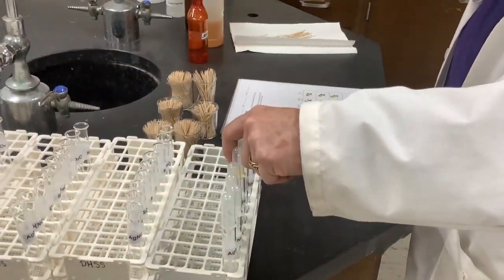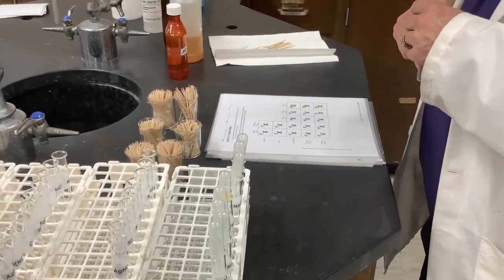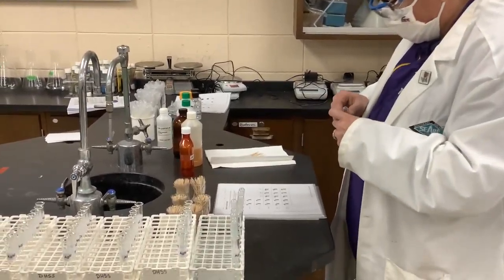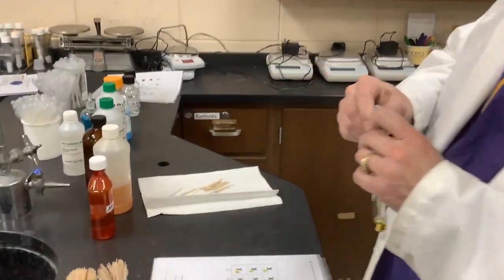The last vertical row is iron(III) chloride with its yellow, rusty tint. It always looks rusty to me — that's not truly the color of rust, but if you look at the bottle, most bottles of iron chloride get that coloration on them, even a glass bottle. Next I'm going to go across with the horizontal rows.